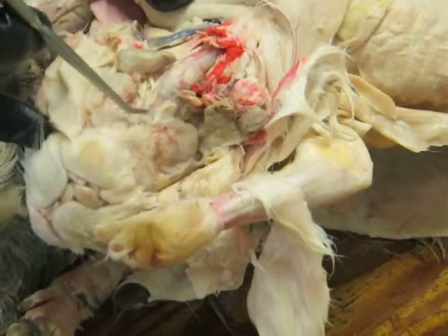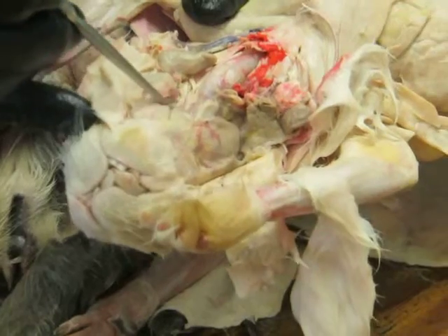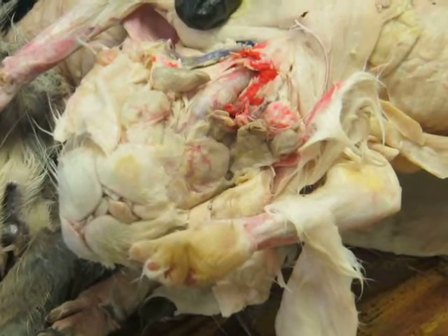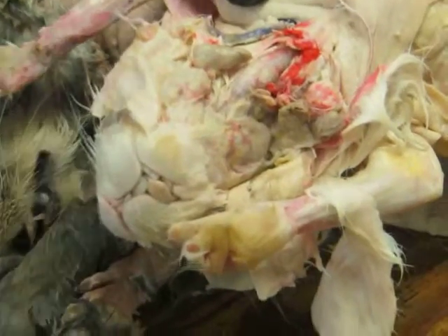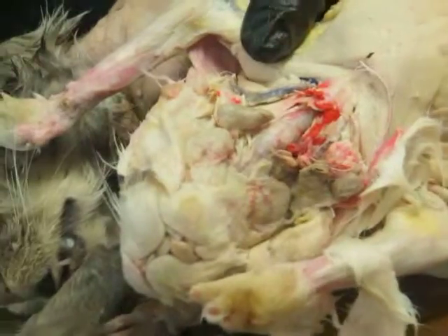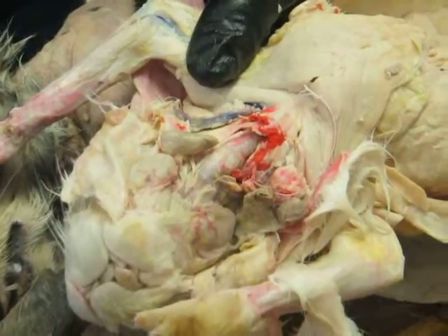and that's the mylohyoid, M-Y-L-O, mylohyoid. And this is pretty much comparable to the intermandibularis that we saw already in Necturus and in sharks. Fibers running across, basically lifting up the floor of the mouth. It's homologous. It's part of the mandibular arch, branchiomeric musculature.